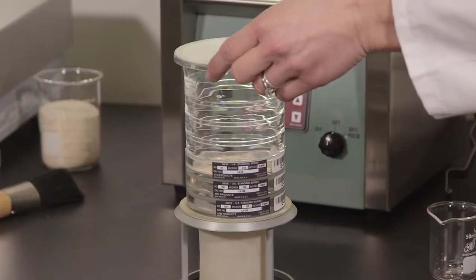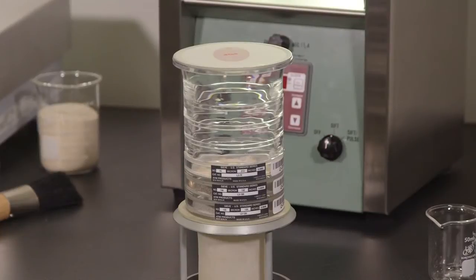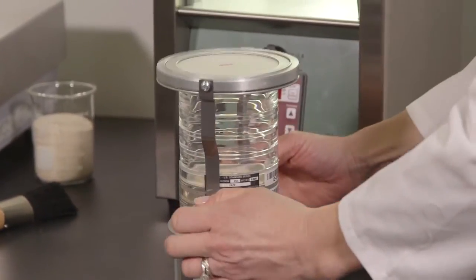Install the diaphragm. When properly oriented, the word top will be visible. Clip everything together with the column lock.